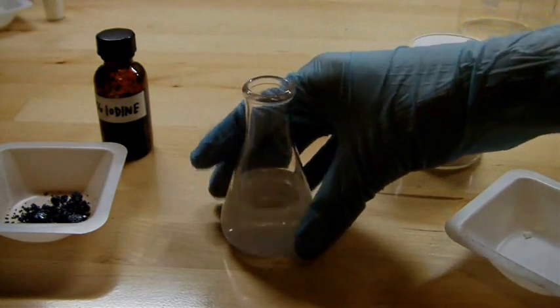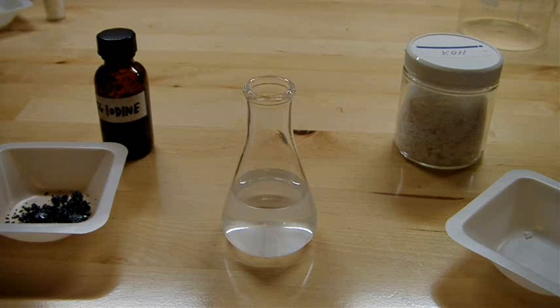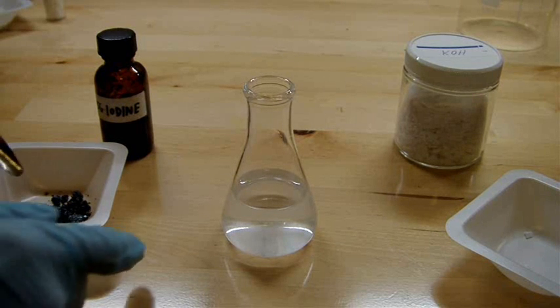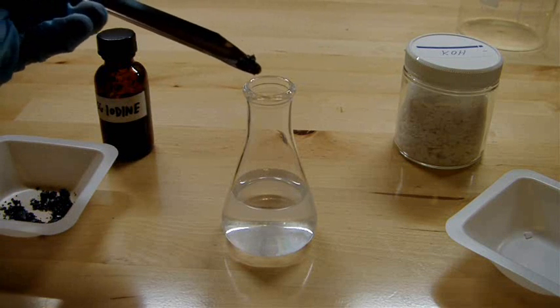That's all dissolved and the solution is fairly warm. So I'm going to add the iodine rather slowly so you can see the reaction take place.